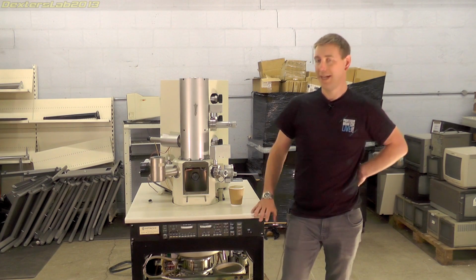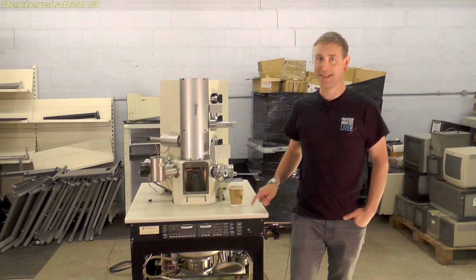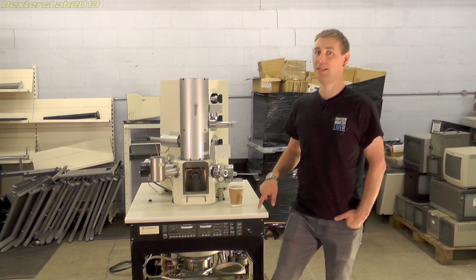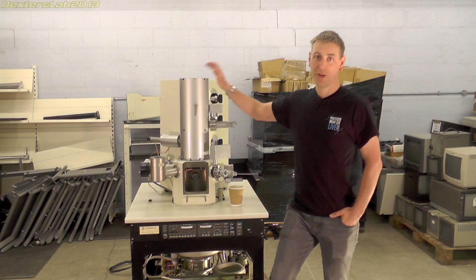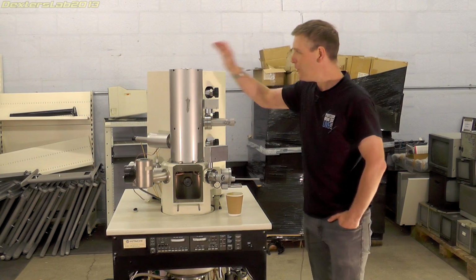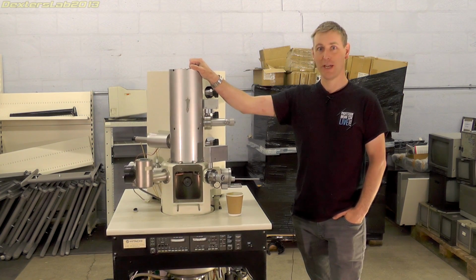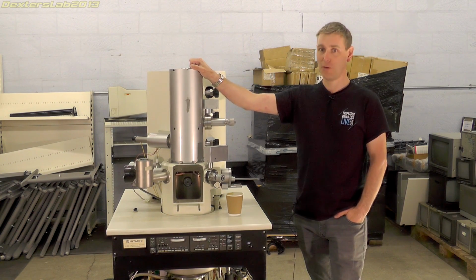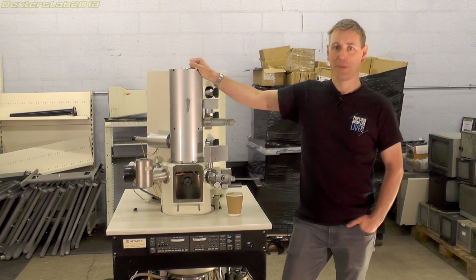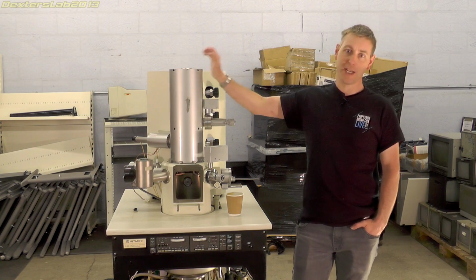This should be quite a special teardown, as this kind of item is particularly rare to find and indeed deal with, as it weighs probably a couple of hundred kilos. So we have this amazing looking and rather enormous Hitachi S800 Scanning Electron Microscope, or SEM, for teardown. I picked this up a few weeks ago with the help of Carl from Carl's Tech Shed.